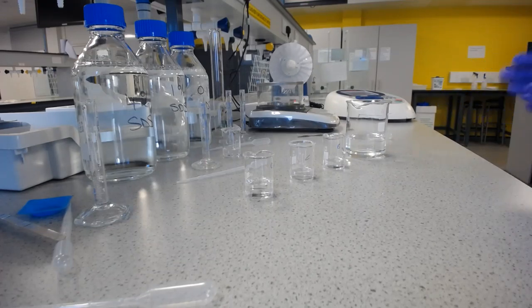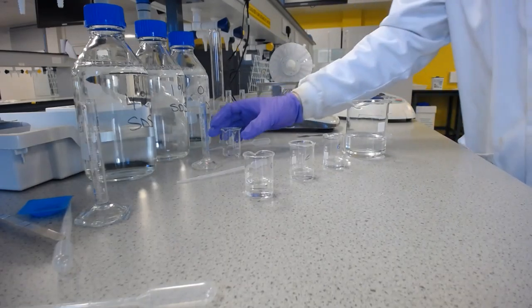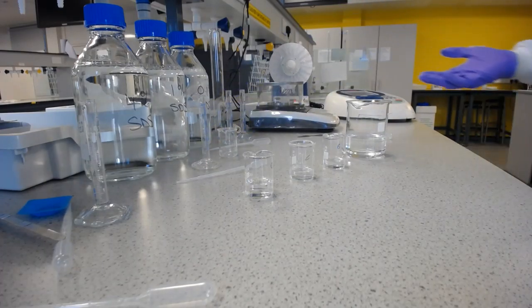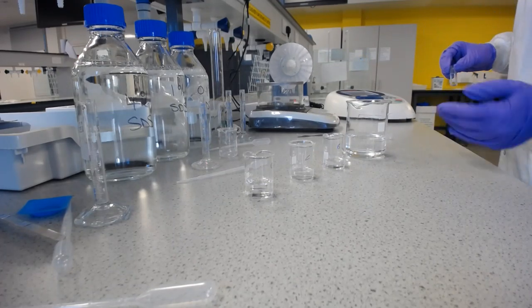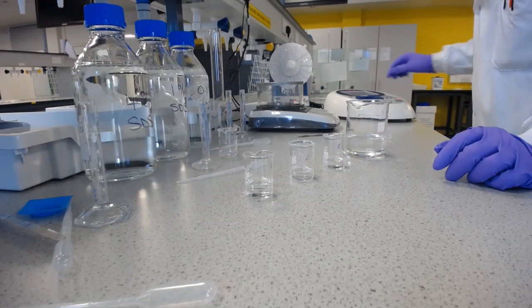And to do that, we need to have the UV vis set up, and we need to blank that with water, because that's the solvent we're using. And remember, when we blank a UV vis, we're telling the UV vis basically everything, the absorbance, to ignore, which includes the cuvette and the solvent, because we're only interested in the concentration of the aspirin. So I'll put that in there.